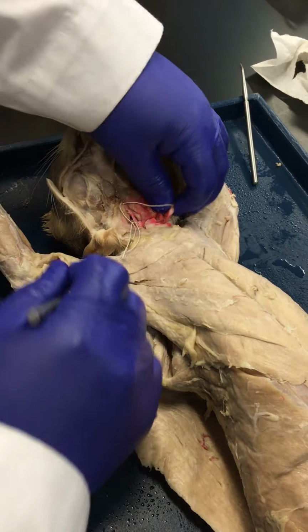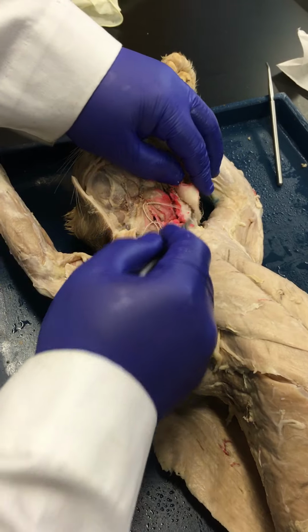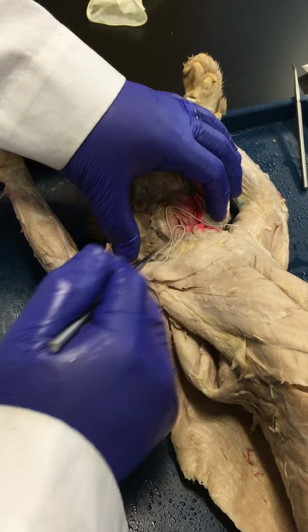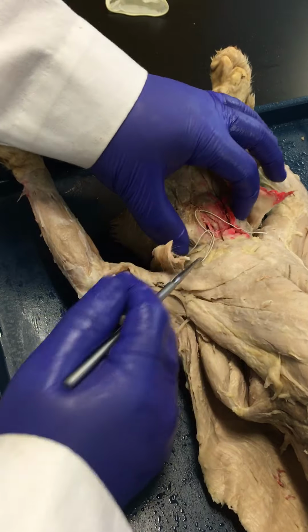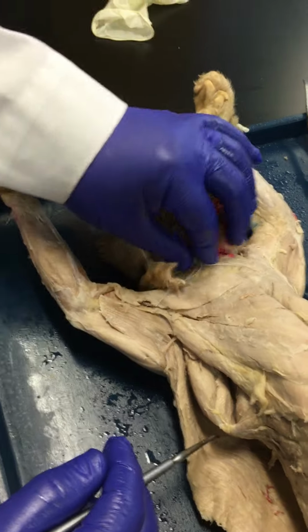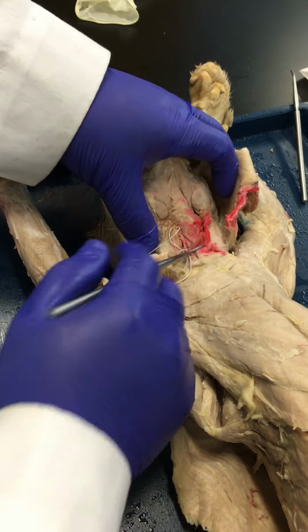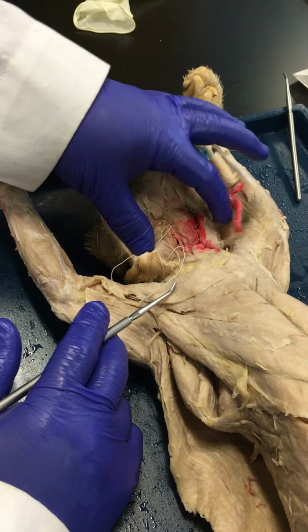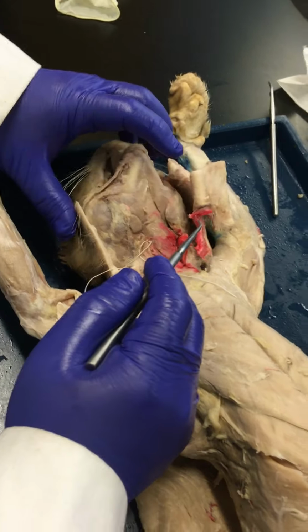Now in the cat, as we move out from there, you would have your cleidomastoid and your sternomastoid. In humans, these two muscles will be made up by a single muscle known as the sternocleidomastoid. Right, so again, in humans, sternocleidomastoid is here. If you're bilaterally contracting the sternocleidomastoid, it's going to flex the neck. And if it's unilaterally contracting, you're going to rotate the head, and it's contralateral rotation.